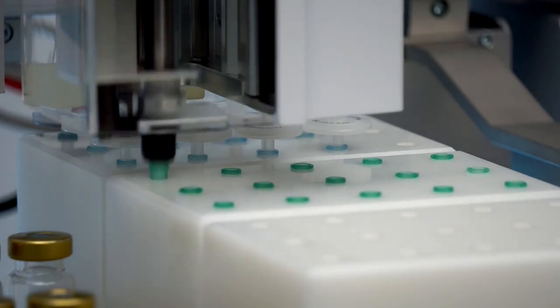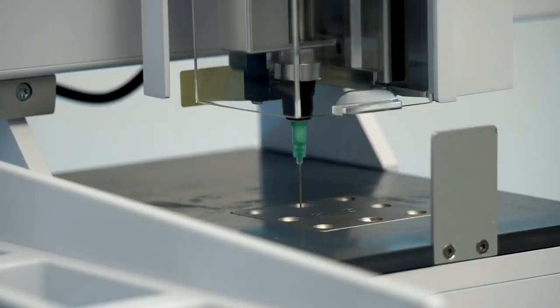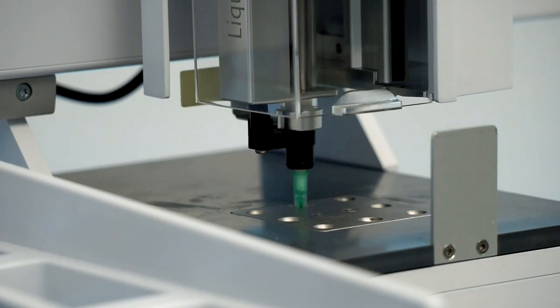The syringe will be removed from the surface of the ultrasonic bath's cover into the headspace of the 20 mL sample vial and eliminates excess pressure by refilling the syringe.